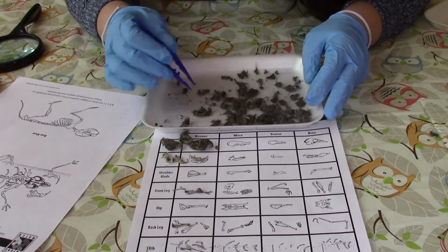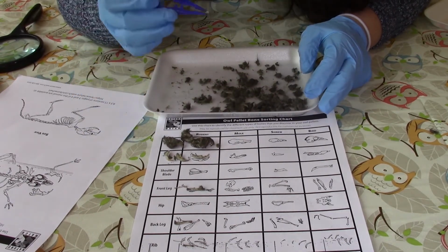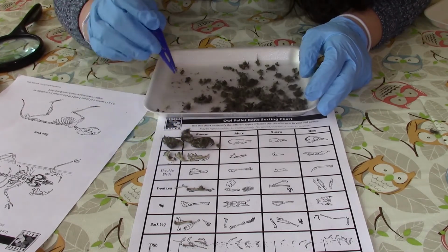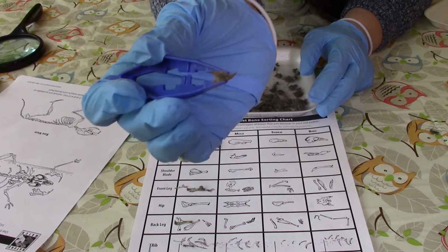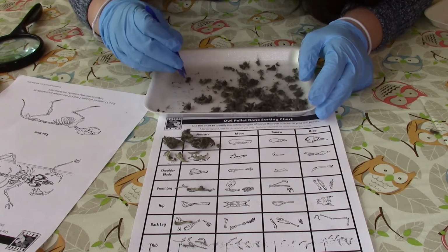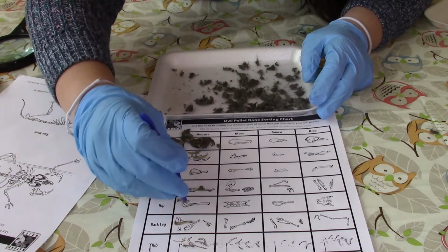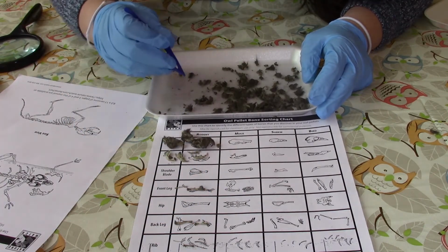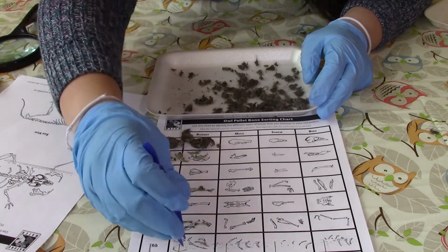But I wanted to see if we can maybe, here it looks like this is another part of a jaw, because you can see there that there's another like really sharp tooth there. And here we have some more like bigger bones, but then here we have some vertebrae or some ribs.